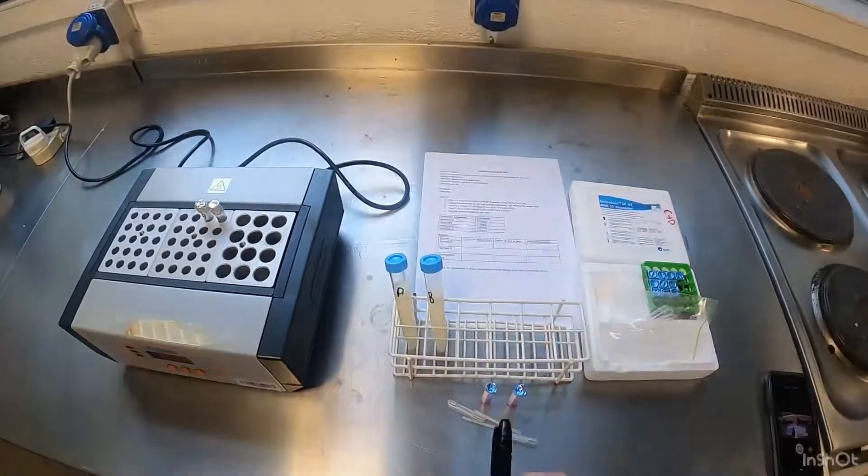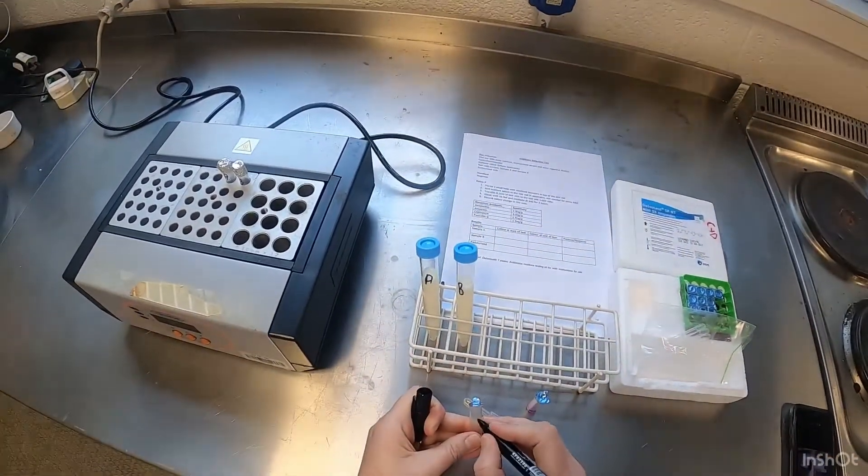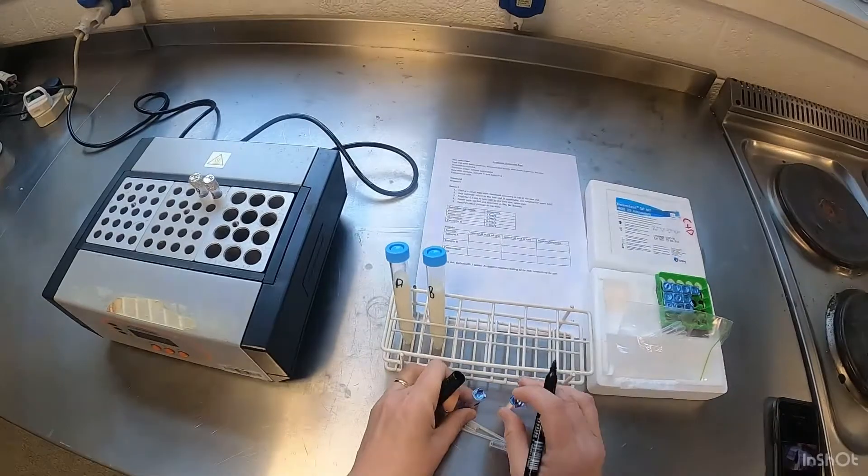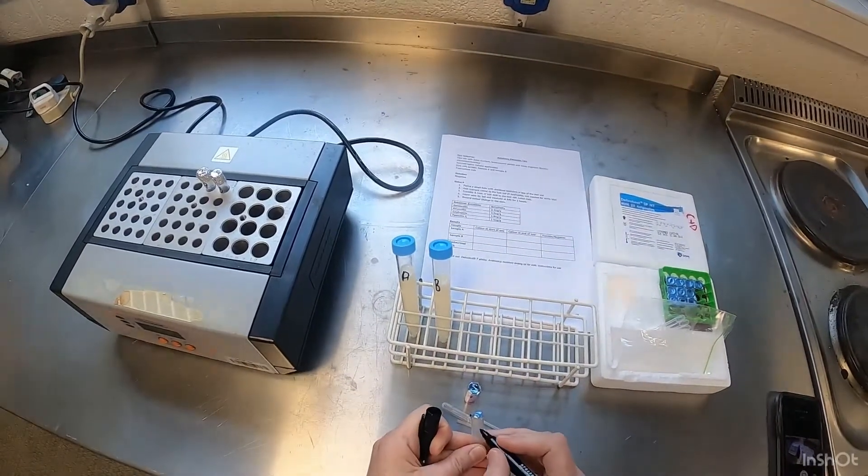I also have a marker so I'm just going to mark my ampoules A and B.